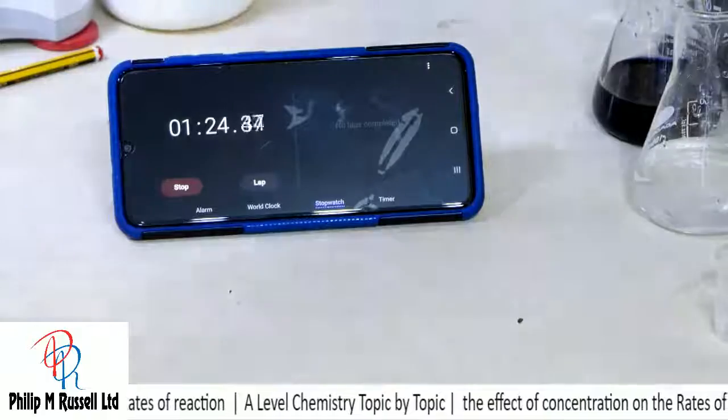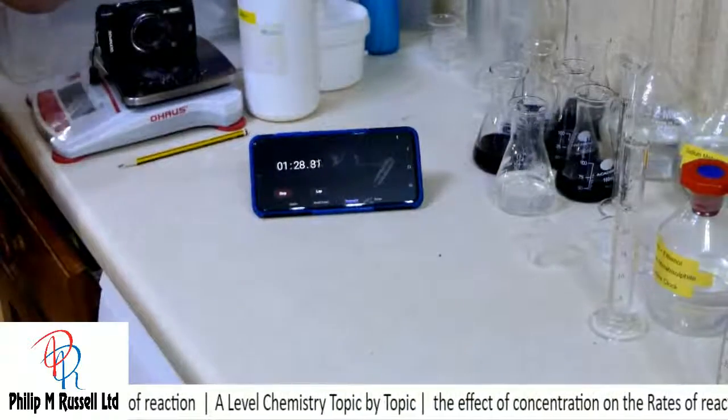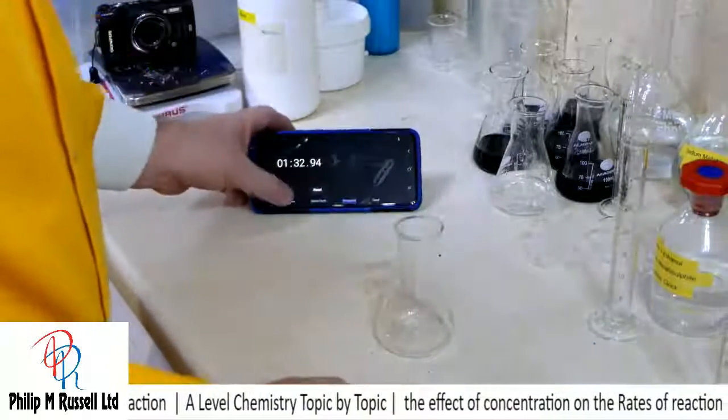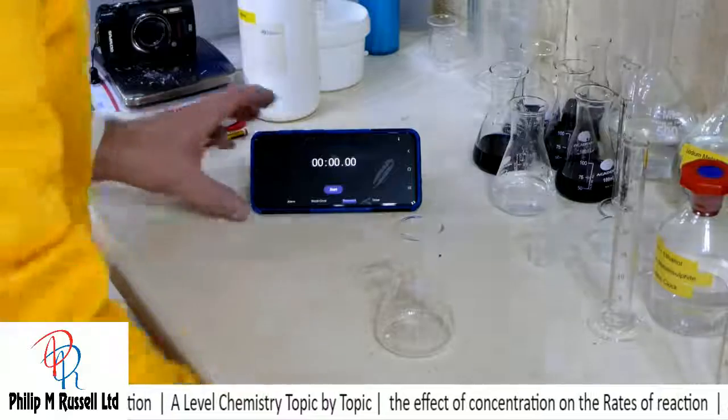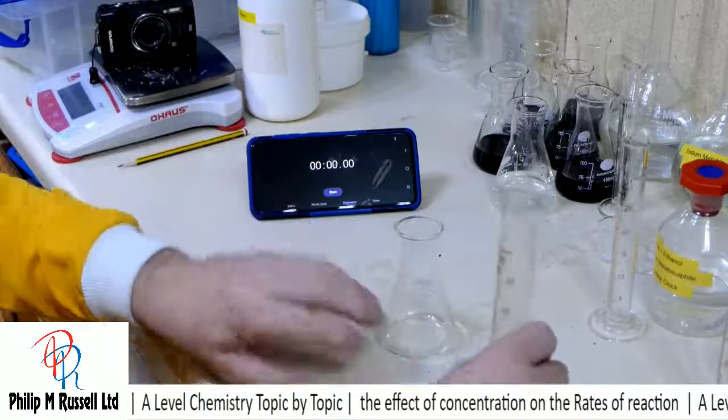Let's do it again. You have the benefit of hindsight. You can go back and wind the video back and see what I didn't do there.